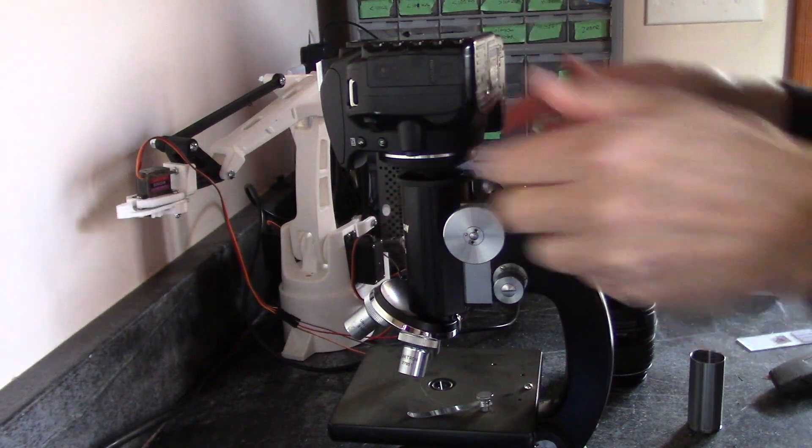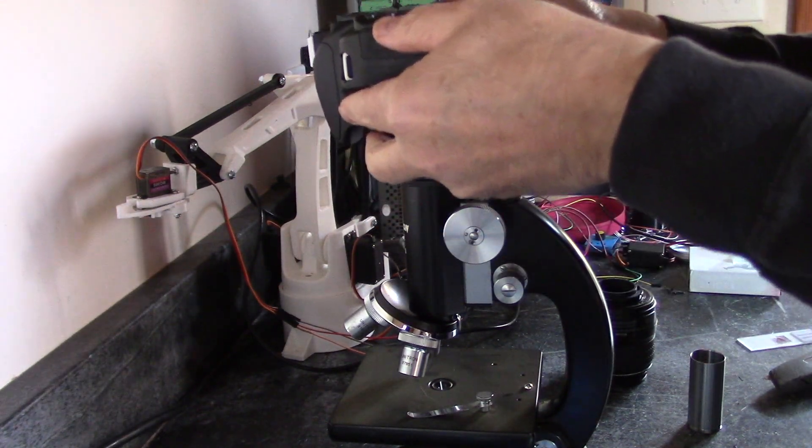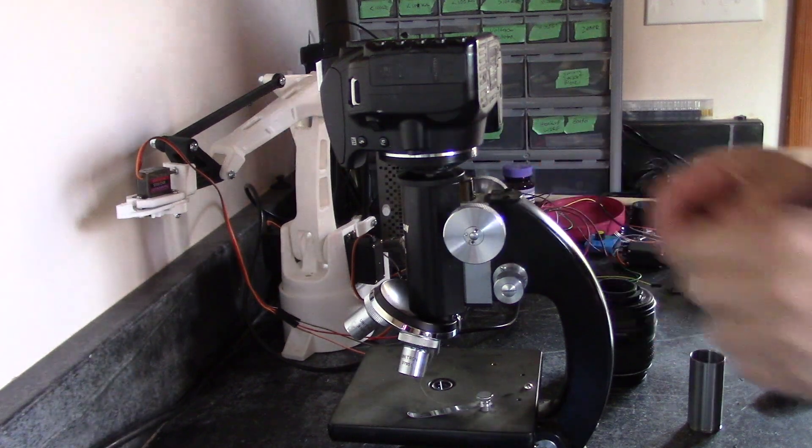So now it's straight up and down, and it slides in and slides out easy, and I already know it works. So let's give it a shot.